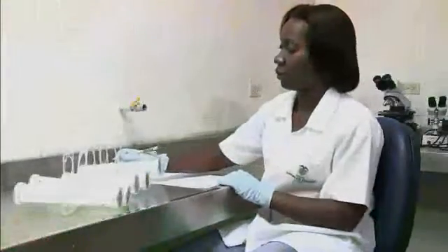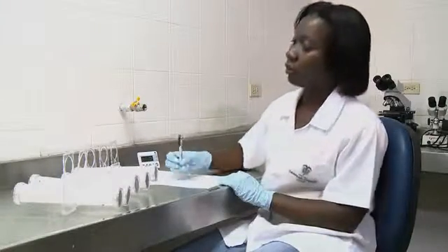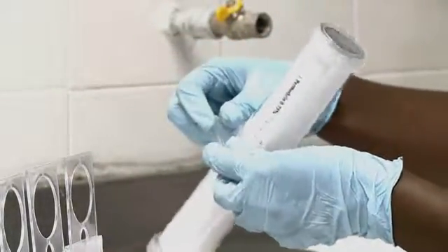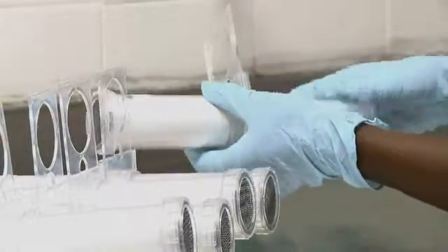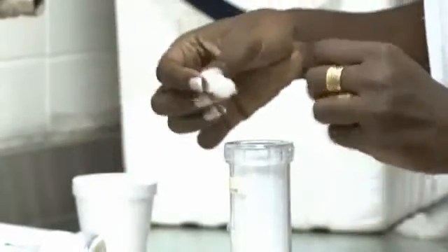For pyrethroids, count mosquito mortality, or the number of mosquitoes knocked down, every 15 minutes during the hour of exposure time. Once the exposure time is finished, transfer the mosquitoes back to the resting tube for 24 hours. Separate the exposure tube from the resting tube. Attach a piece of cotton wool soaked in a 10% sugar solution to each resting tube.